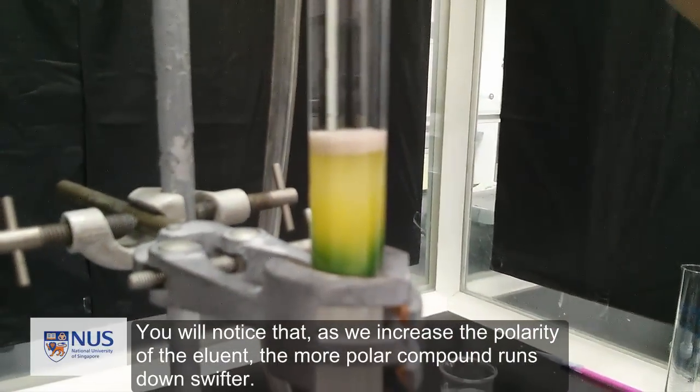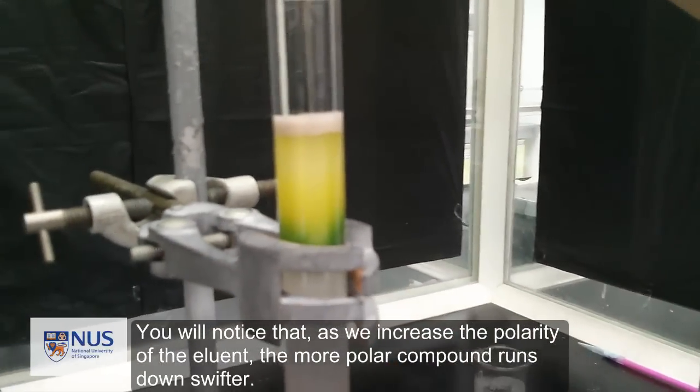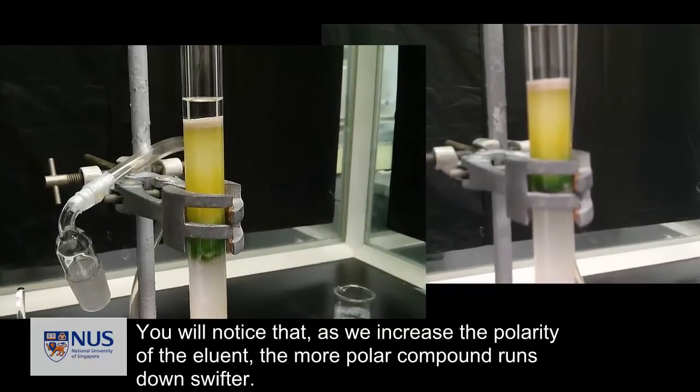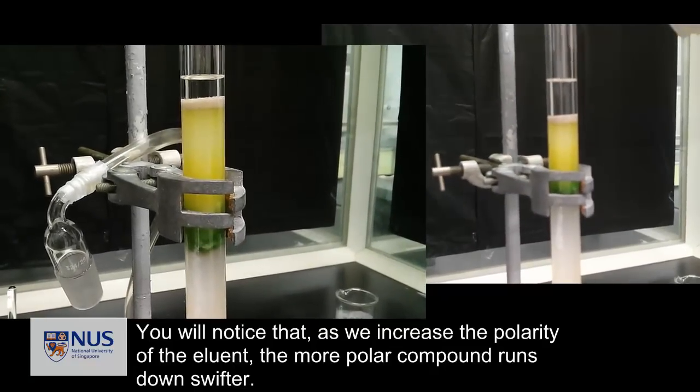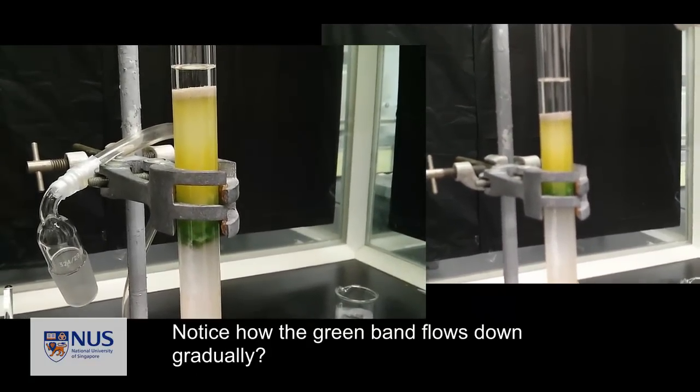You will notice that as we increase the polarity of the eluent, the more polar compound runs down swifter. Notice how the green band flows down gradually.